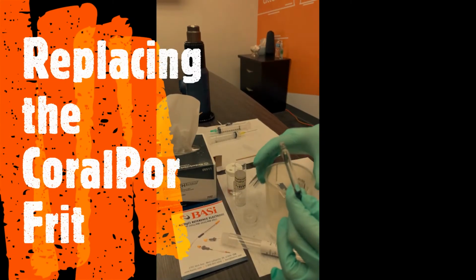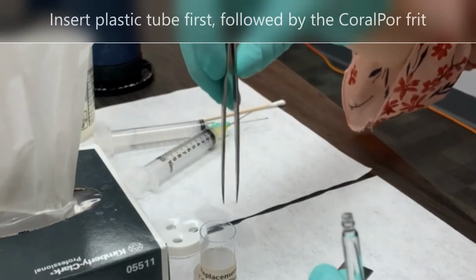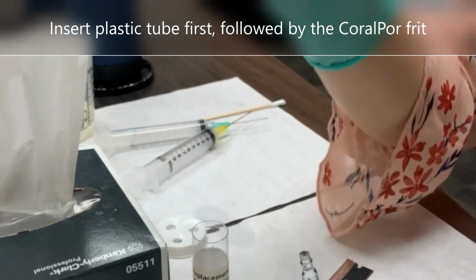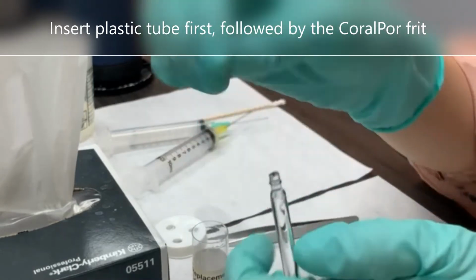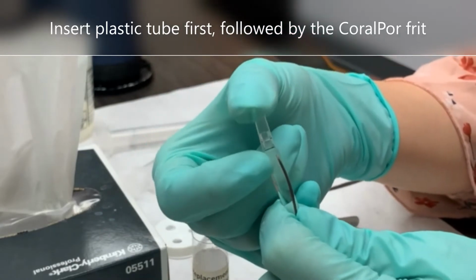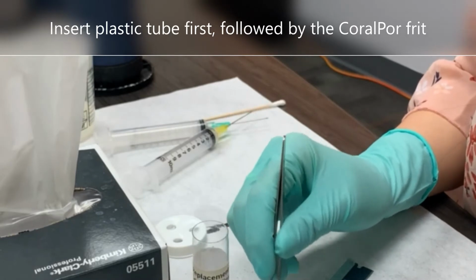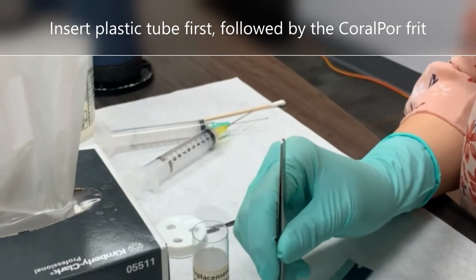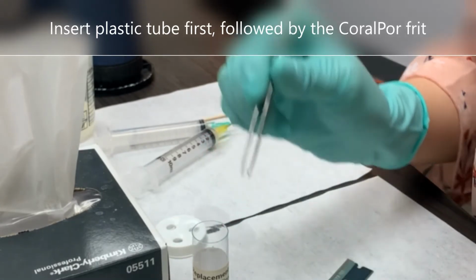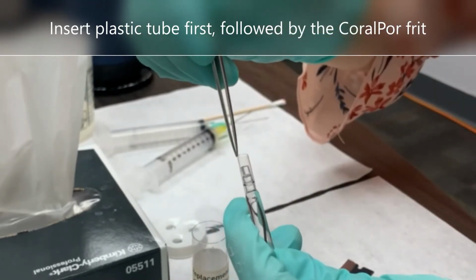Now we're ready to replace the CoralPor. Grab one of your replacement plastic tubes and insert it directly. And one of your replacement CoralPor Frits, here, and insert it directly as well.